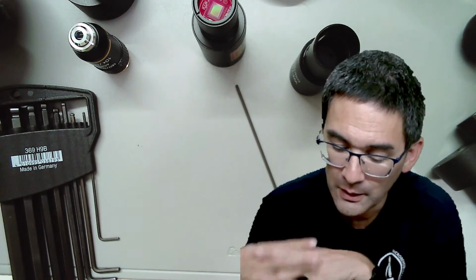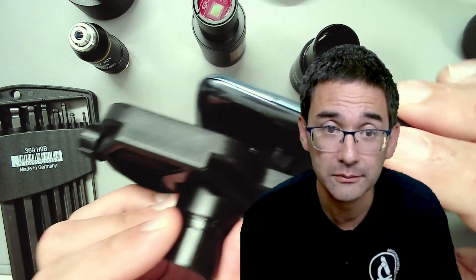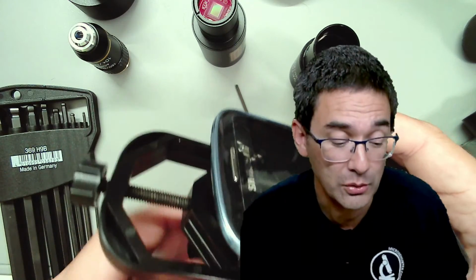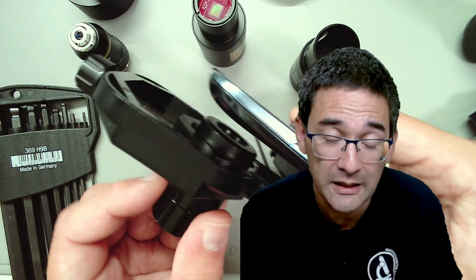Unfortunately, there is no perfect system around if you do not have a camera yet. But if you do have a mobile phone, then the first thing that I definitely recommend, simply because it's so cheap, is to get a mobile phone adapter. It really adds a lot of value in the sense that it's easier to make pictures. Disadvantage, of course, it's a little bit wobbly and takes time to set up, and patience.